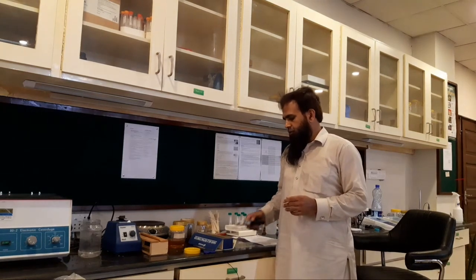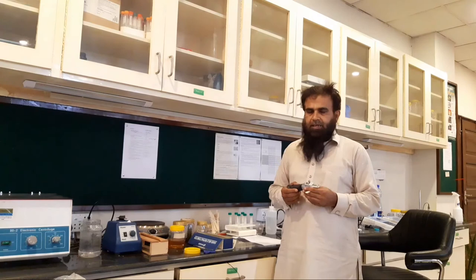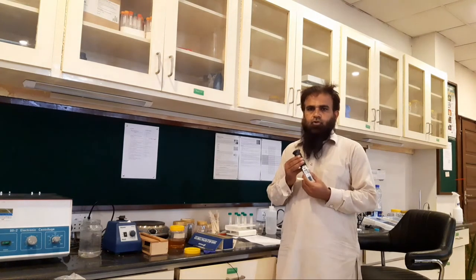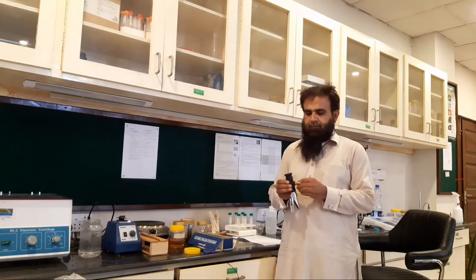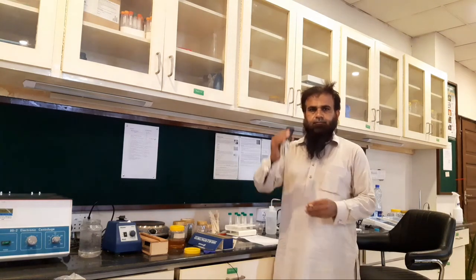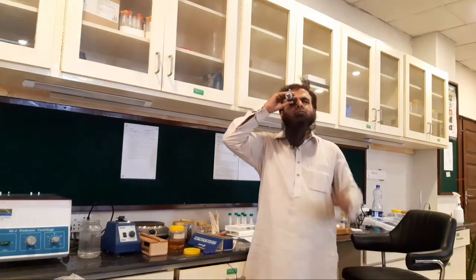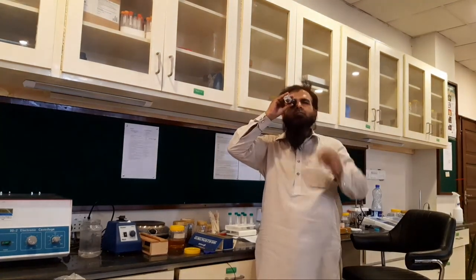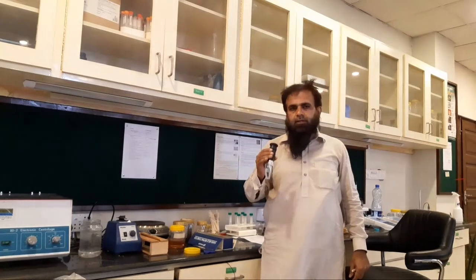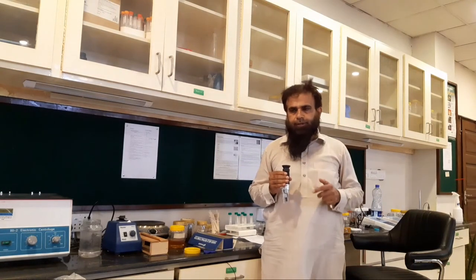Now, how to use the refractometer to determine the moisture content of honey. First, we should hold the refractometer between our thumb and four fingers, just like this. The scale in the refractometer ranges from 20 to 30.